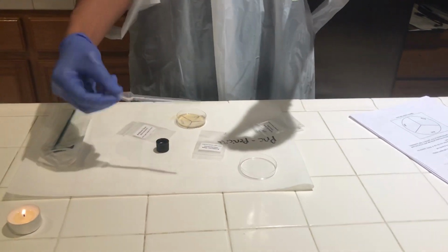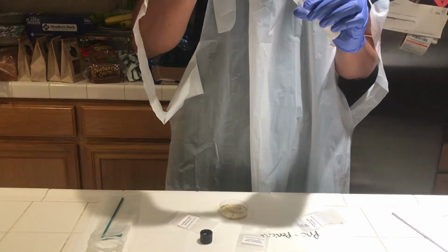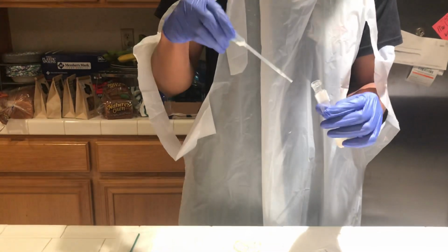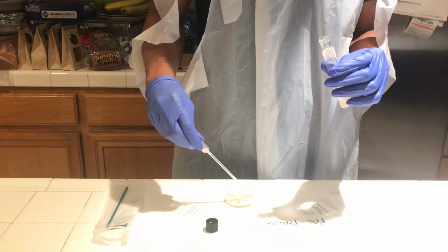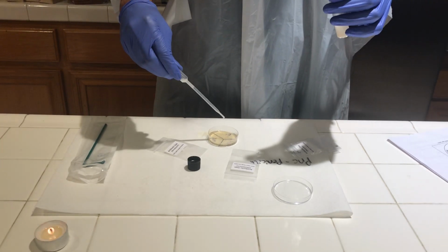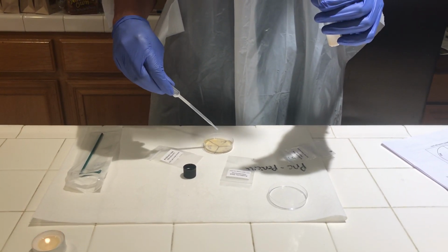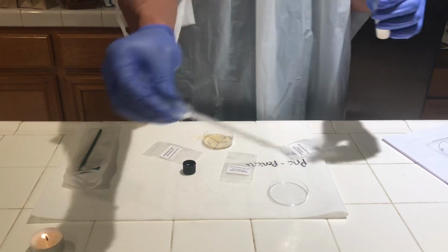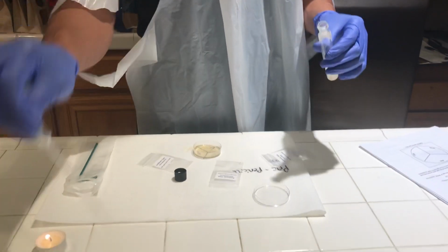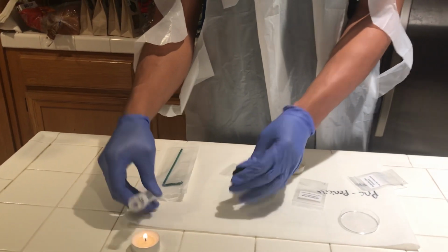Bring this out. 0.5. 8 drops. 2, 3, 4, 5, 6, 7, 8. Push that in there. Put that in bleach. Sterilize this again. And place the cap on.